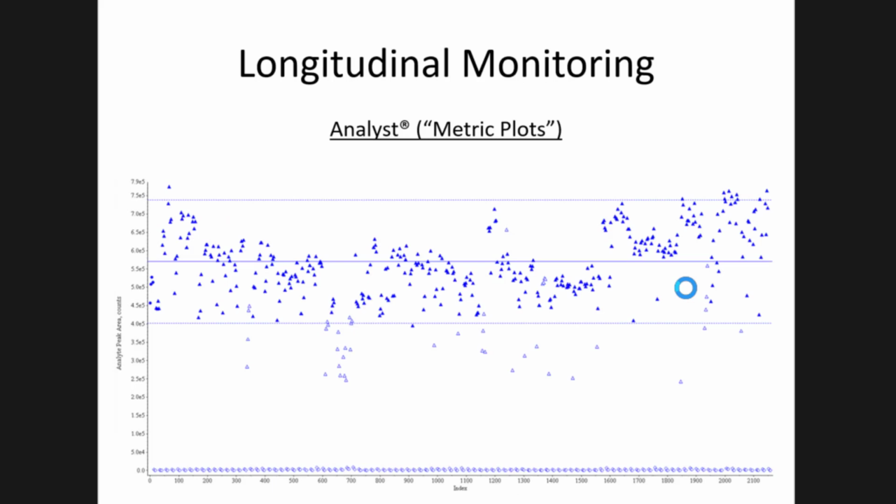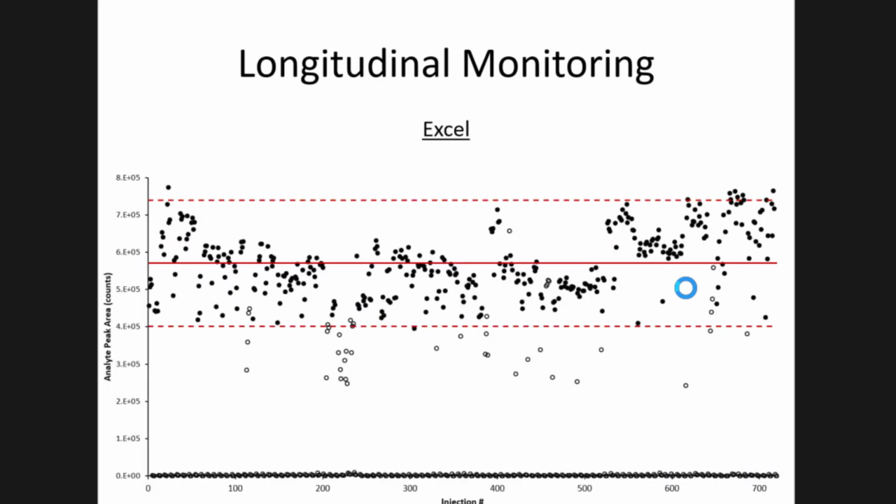So there are other ways you can look at it besides Skyline, and some of the vendors might have software that do that. This is a metrics plot out of Analyst, if you're using a SCIEX instrument, that's looking at peak area over number of injections. And so here you can define the average and then standard deviation or confidence intervals outside of which you would want to say, oh, something bad is happening. You can do the same thing in Excel. Again, a little more labor intensive, but it builds character, right?